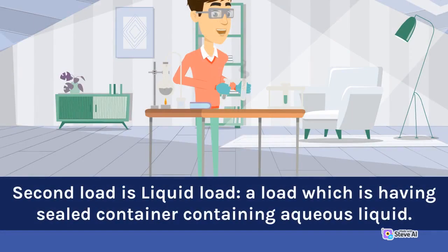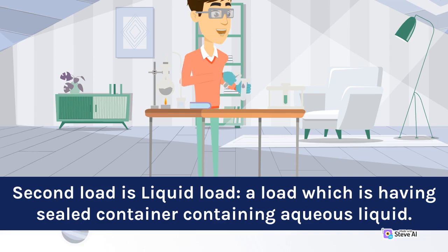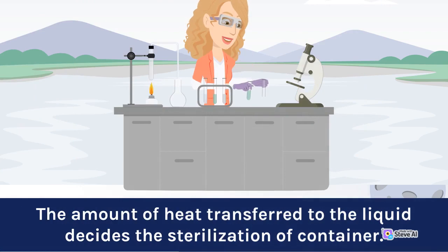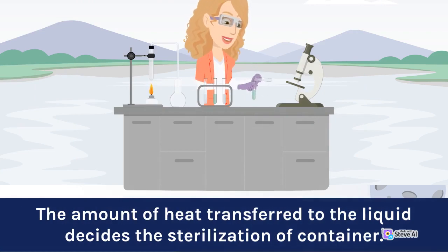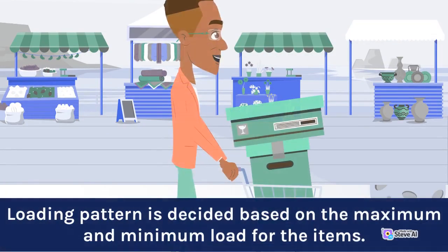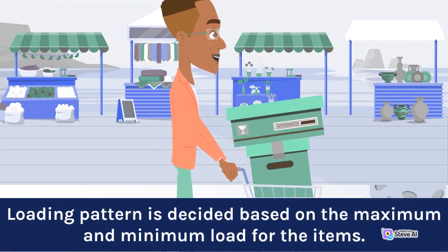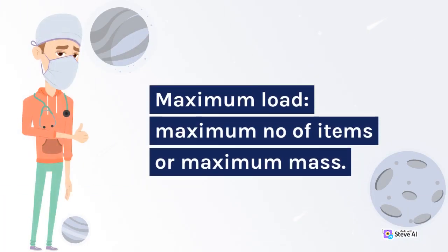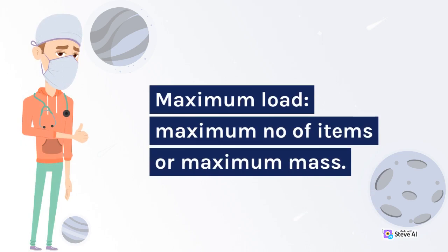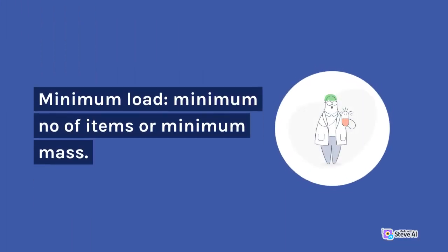The second load is liquid load — a load which has sealed containers containing aqueous liquid. The amount of heat transferred to the liquid decides the sterilization of the container. Loading pattern is decided based on the maximum and minimum load for the items. Maximum load refers to the maximum number of items or maximum mass; minimum load refers to the minimum number of items or minimum mass.